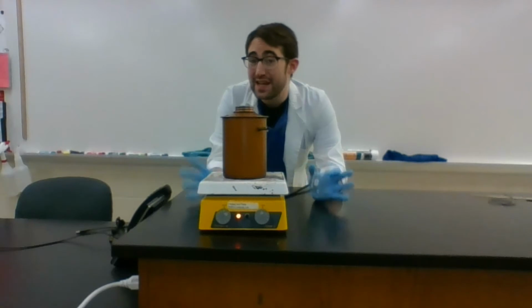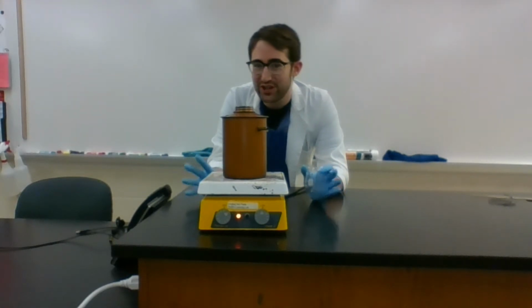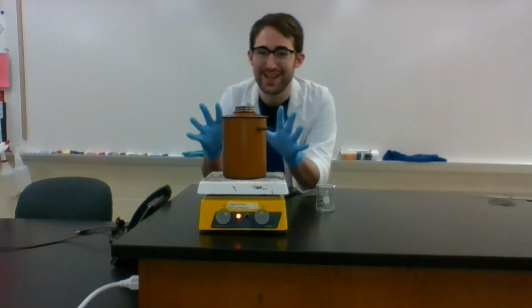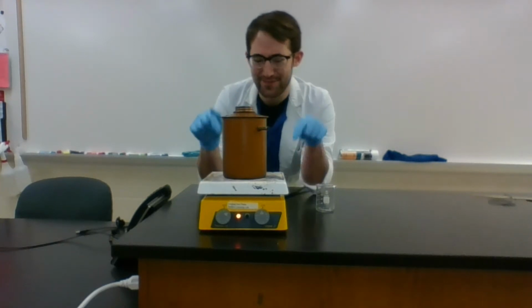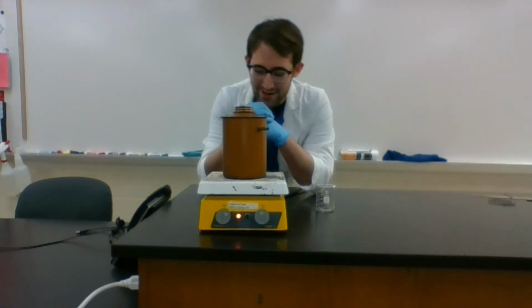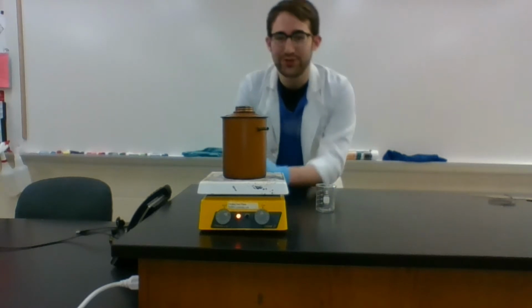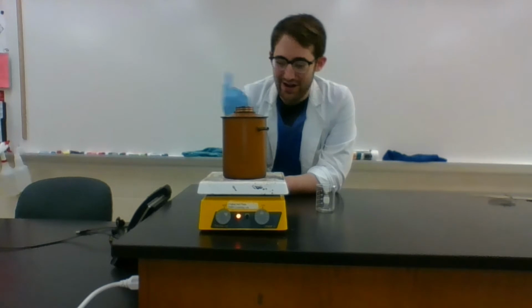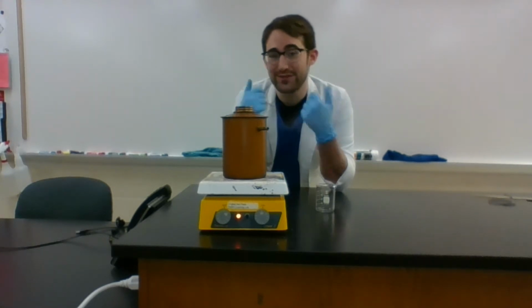Okay, so heat being released can be a good sign of a chemical change, a good clue that a chemical change is happening. And right here, I have a lot of heat coming off of this. Okay, now does that mean that a chemical change is happening inside this hot plate to make the heat be released? No, maybe not. It's being powered by electricity. And in some simple terms, essentially I just have the electricity running around inside this hot plate, and that extra energy that's shed off comes off as heat.